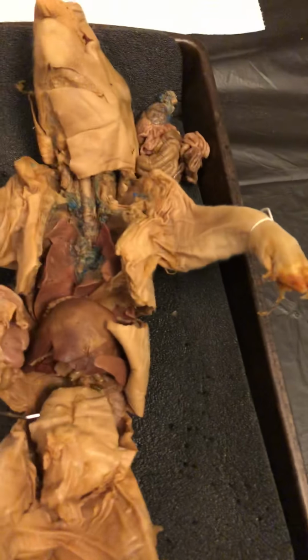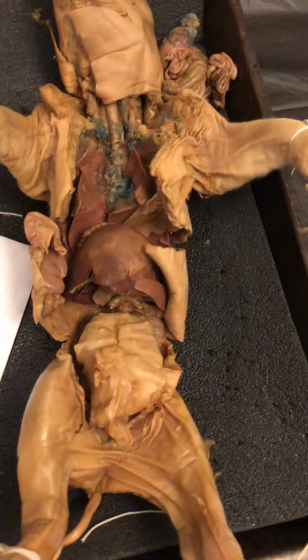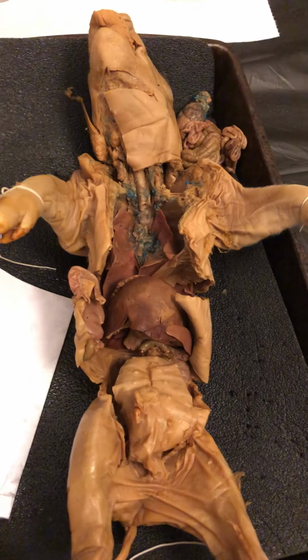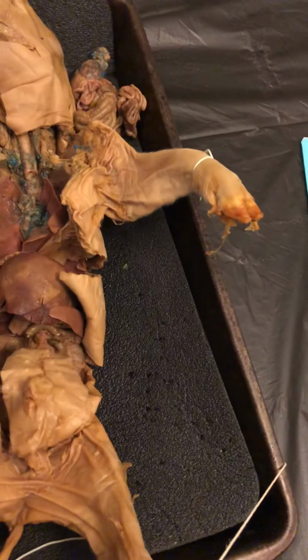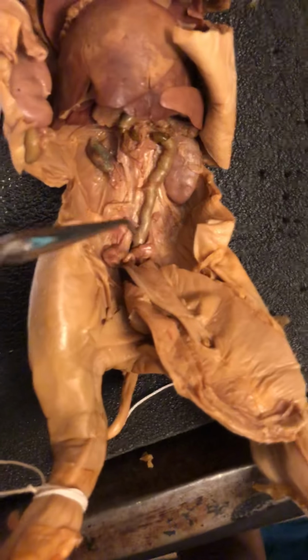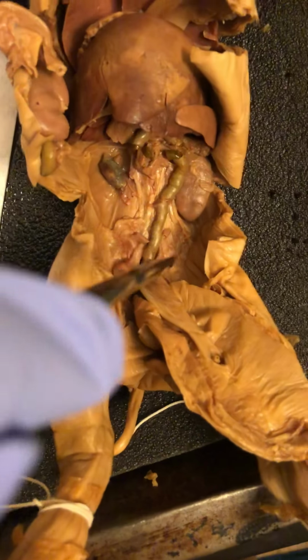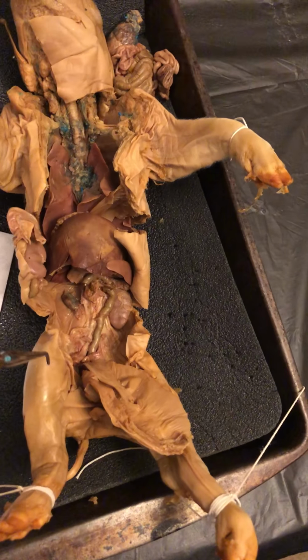Alrighty, so I'm going to go ahead and list some anatomical features of the female reproductive system. A couple of things, a big difference between the fetal pig and the human is where implantation actually occurs in the reproductive system of the fetal pig and the human. So in the fetal pig, the implantation actually occurs in the horns of the uterus, which are located right here. Okay, because pigs actually give birth to about 8 to 10 babies.